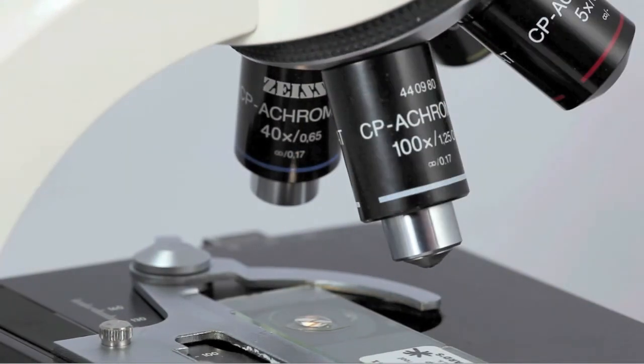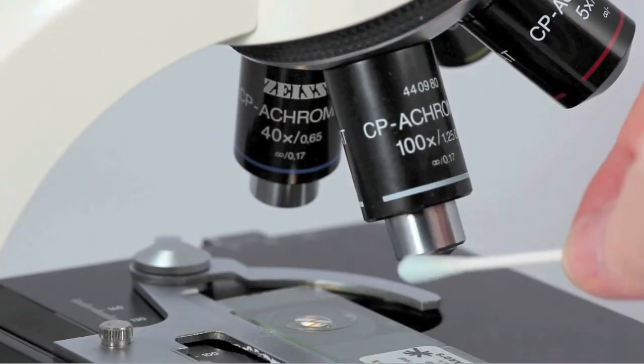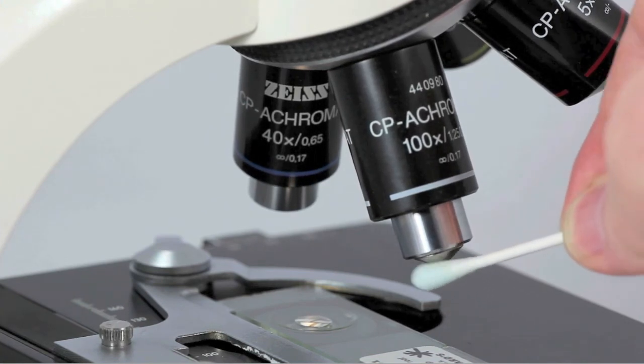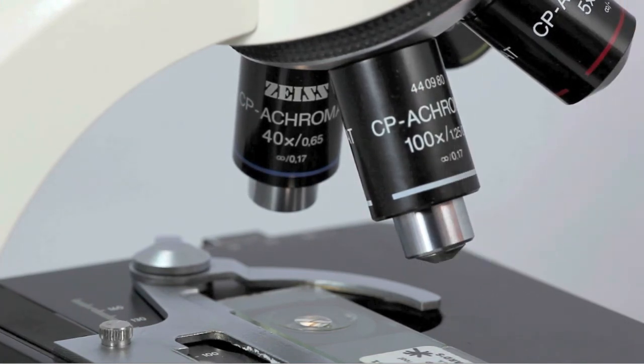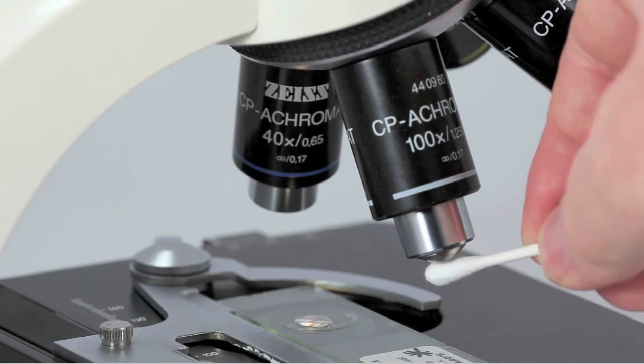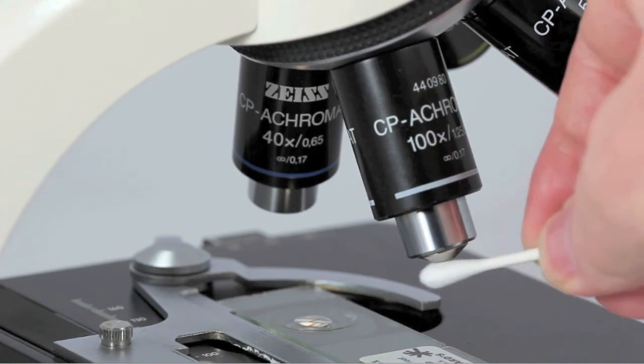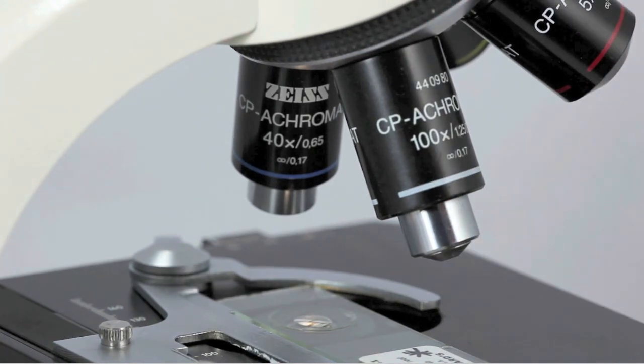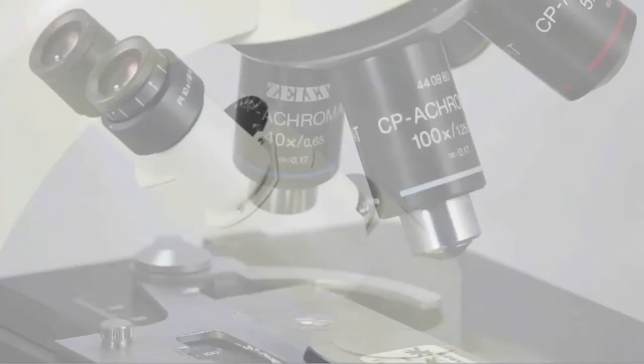Rotate the lens toward you and clean the end with a swab soaked in lens cleaning fluid. Dry the lens with the opposite end of the swab. Now you're ready to look at the next slide or to put the microscope away.